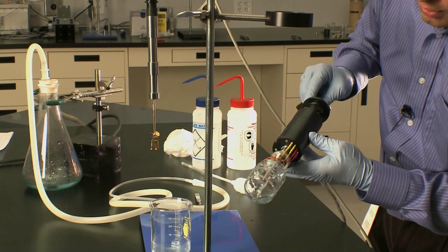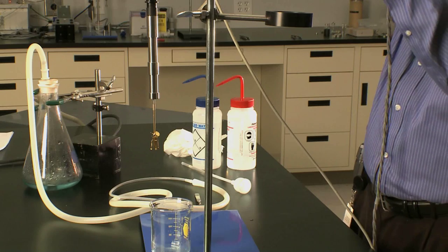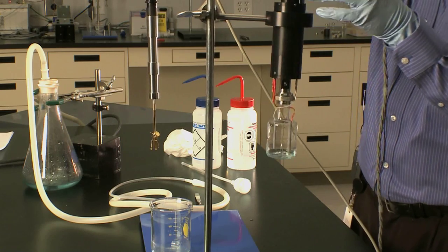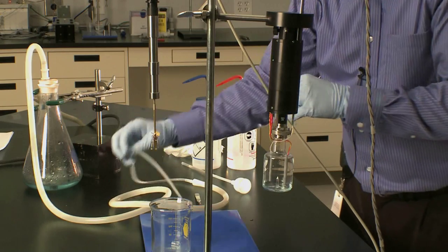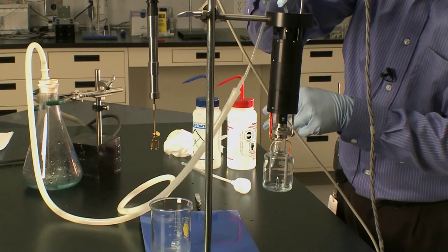Rinse the glass and make sure it's clean. Then extract the rest of the solution with the vacuum.